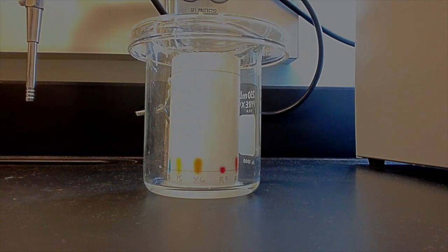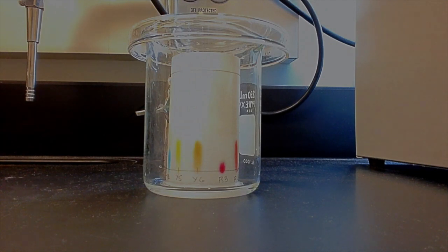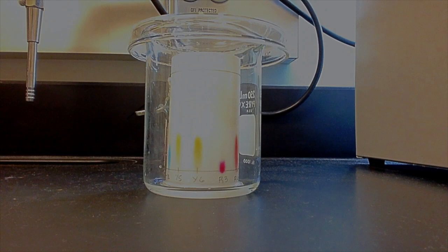Place your chromatography paper into your 250 ml beaker which contains your solvent, and place the petri dish on top. Be careful not to swish the solvent around once your paper is in the beaker. Wait for the solvent to reach your top margin.